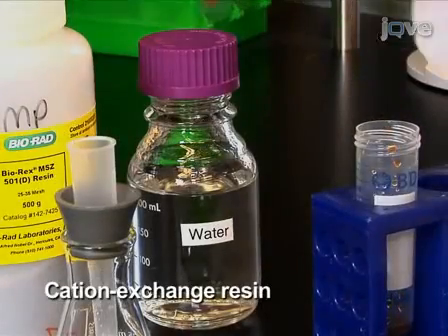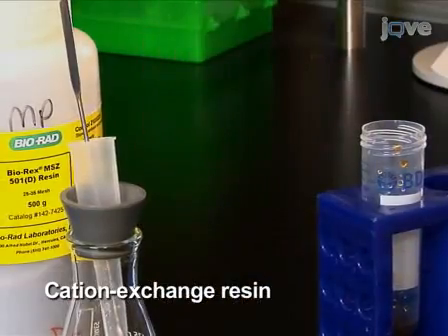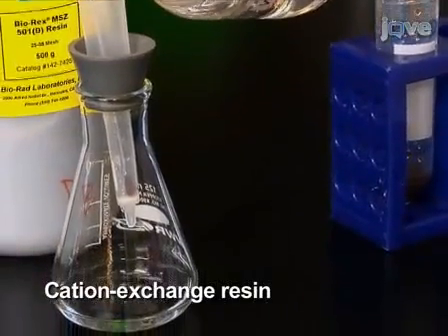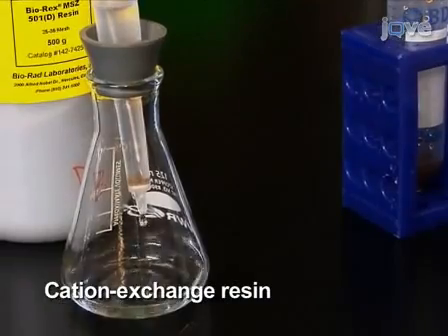Salts and enzyme are removed from the digested sample using the cation exchange resin beads from Biorex MSZ 501. The beads are first conditioned by placing the needed amount in an empty column and washing the beads with copious amounts of water.